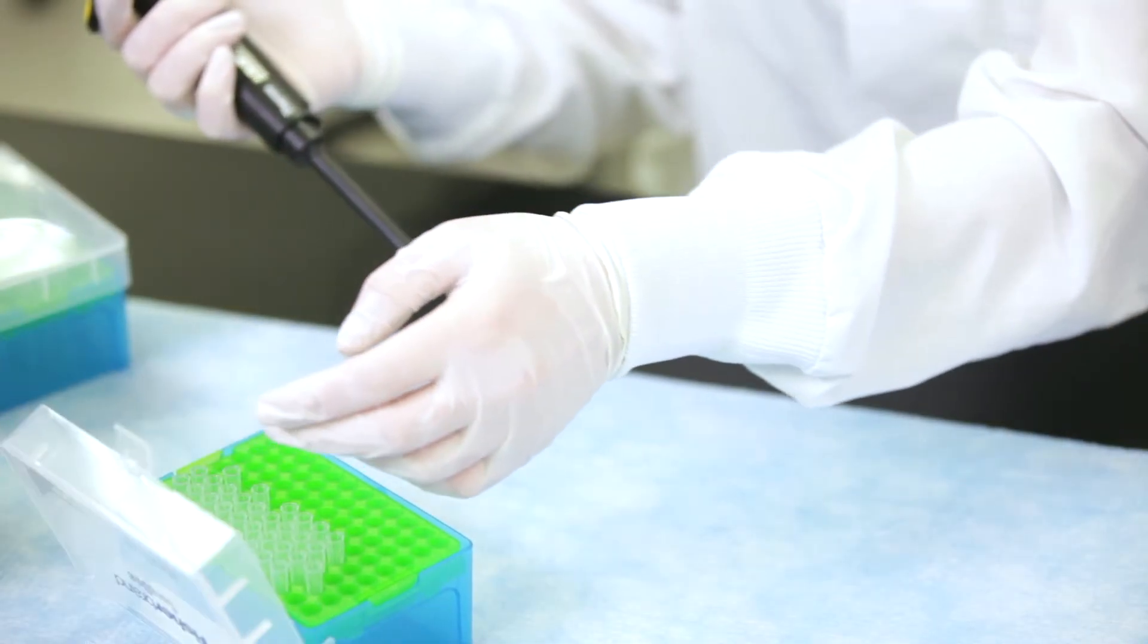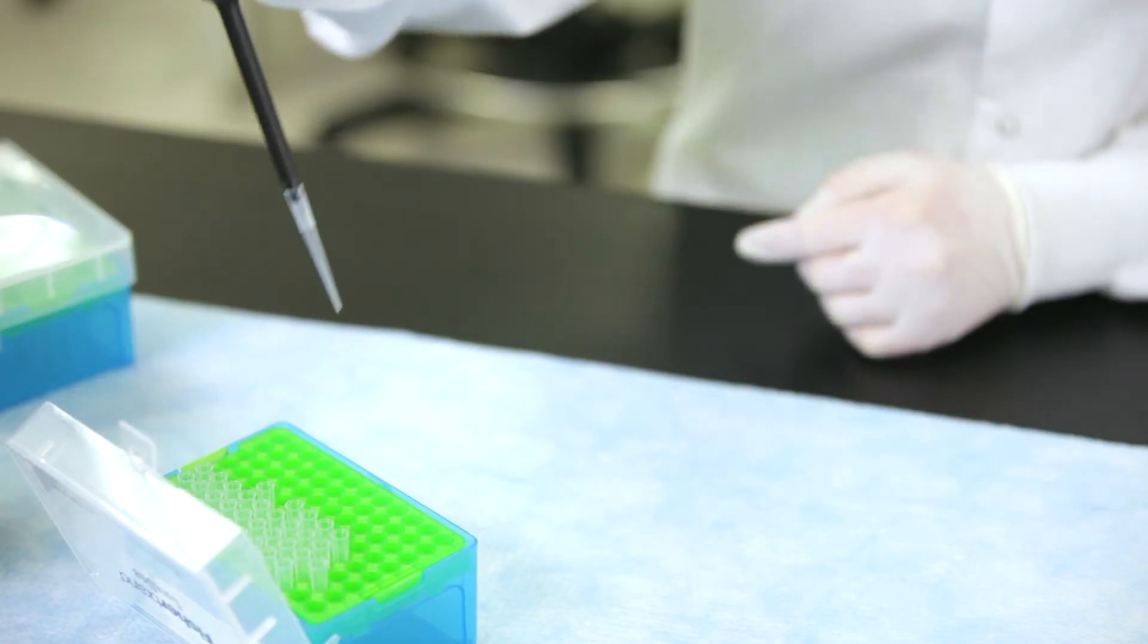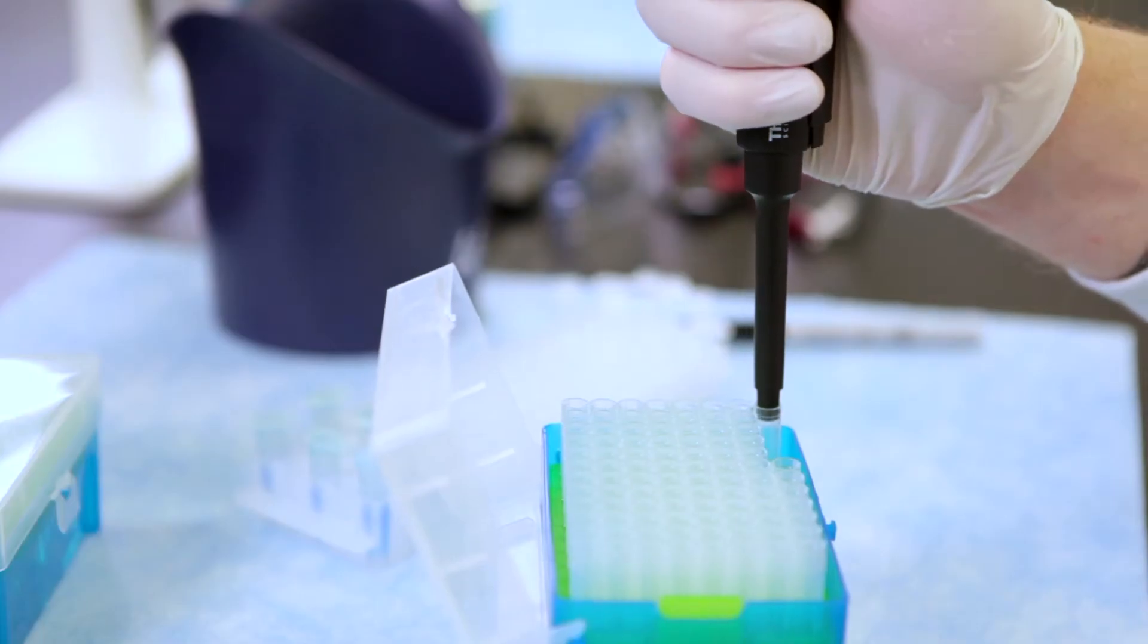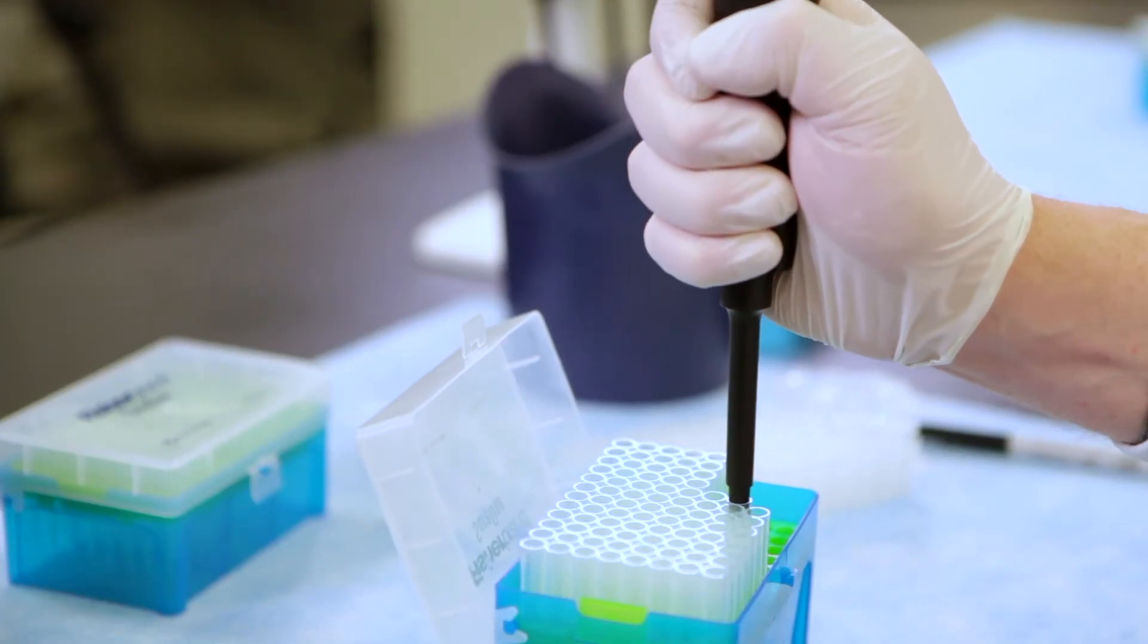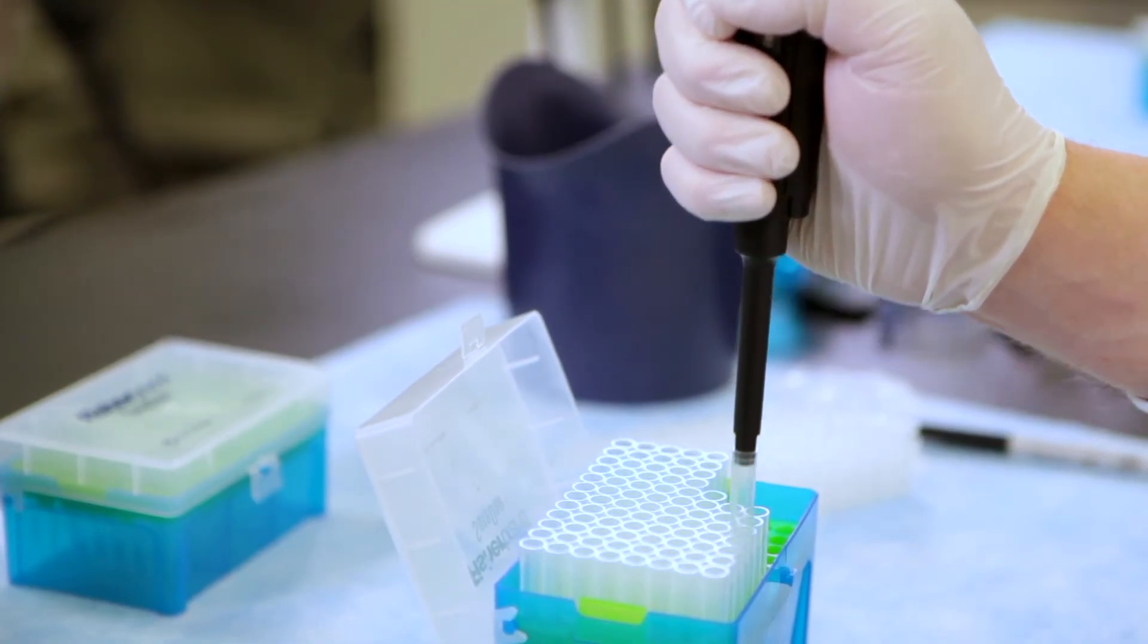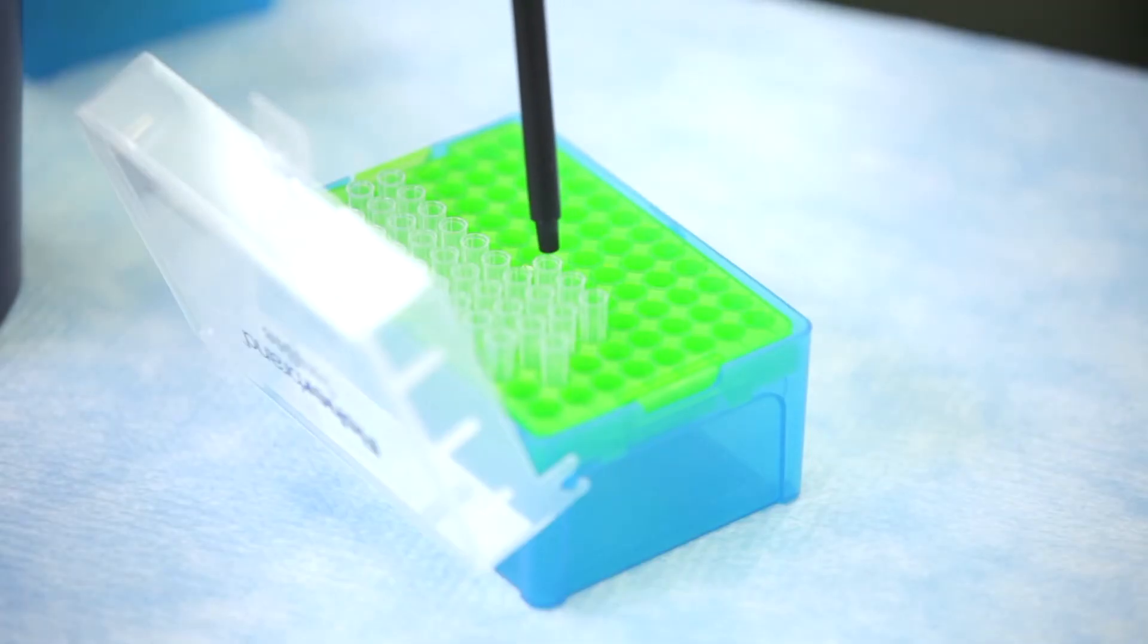To do this, hold the pipette with one hand, aim into the opening in the tip, and gently but firmly push the pipette into the pipette tip. Tips should be arranged in a tip box. You should not have to slam the tip into the end of the pipette. The tip only needs to be on far enough so that it doesn't fall off.